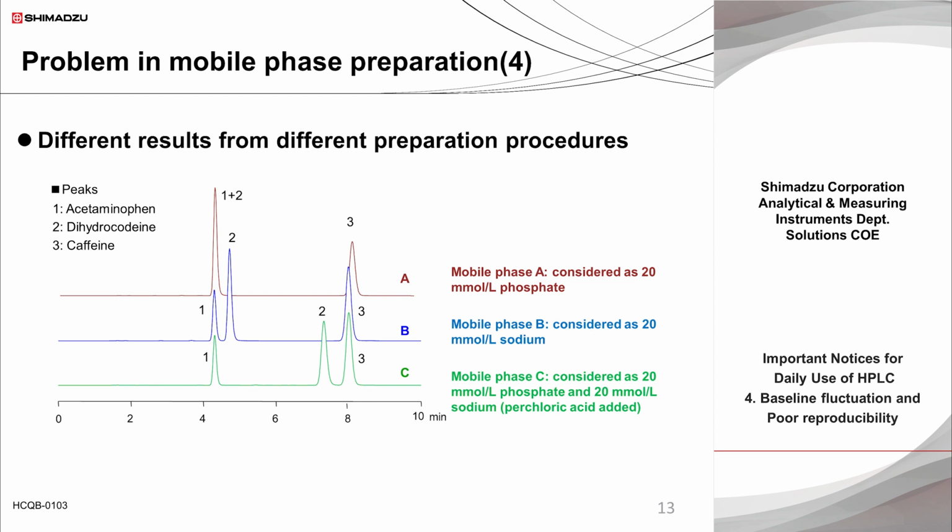This is thought to provide longer retention, as the rate of paired, meaning effectively uncharged, dihydrocodeine also increases, and the hydrophobic retention in reversed phase mode becomes larger due to its lower polarity. Furthermore, in the case of chromatogram C in the lower panel, perchlorate ions used for pH adjustment can easily form ion pairs with positively charged compounds very efficiently. This is thought to provide a larger disappearance rate of the charged dihydrocodeine molecules than in the case of employing only phosphate buffer, resulting in increased hydrophobicity and longer retention.